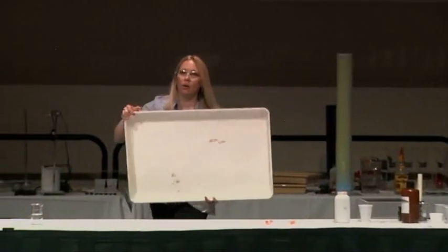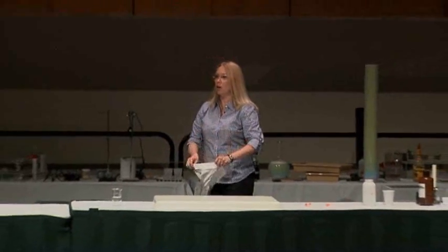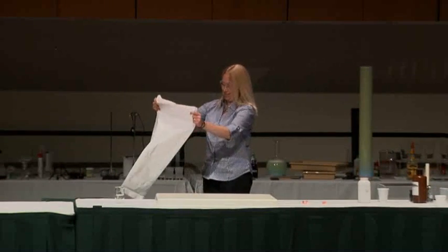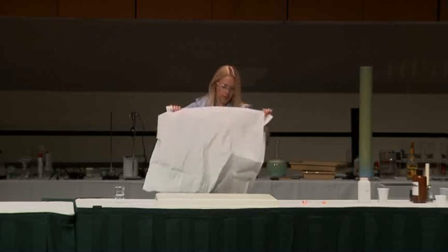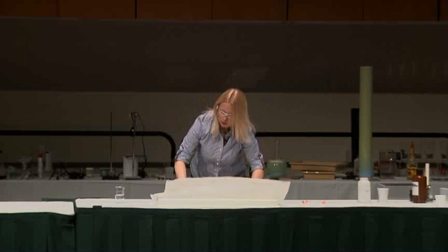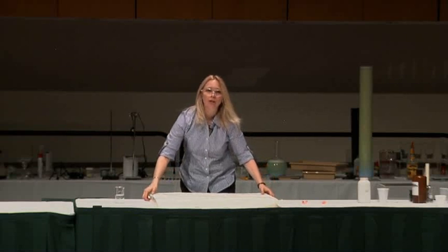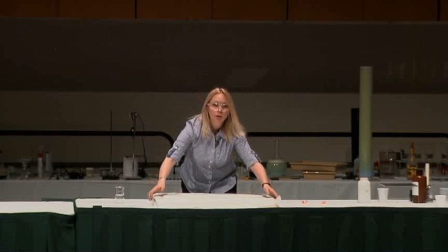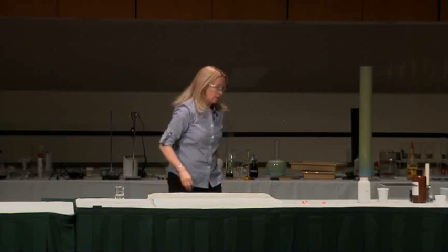Let's take a demo that you can get 500 miles out of and make it glow. So that's what we're going to do. This is a classic — what do you call it, elephant's toothpaste? Do you call it old foamy? Who calls it elephant's toothpaste? Who calls it old foamy? Who doesn't care? It's just good peroxide.